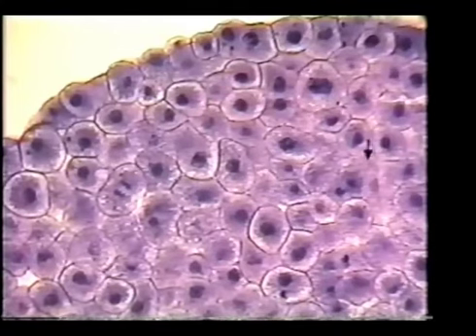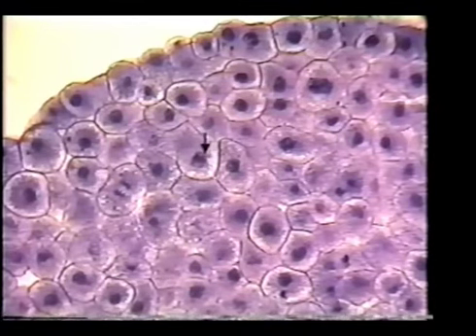On some real cells, this cell is probably in prophase. The nuclear membrane is not as intact. This cell, you notice the edge of the membrane along here is beginning to break apart. Here you see that the dark area in the center is not smooth and homogeneous like it was in the interphase cells. This cell is in prophase.